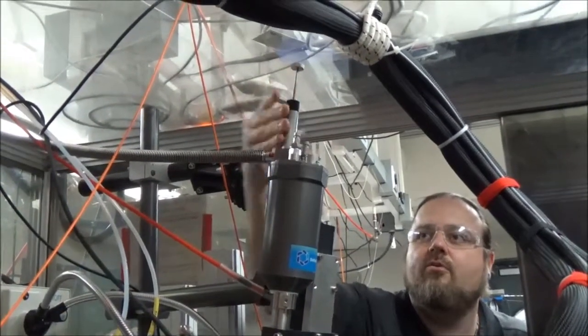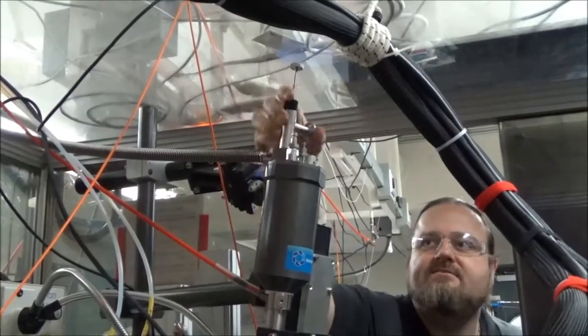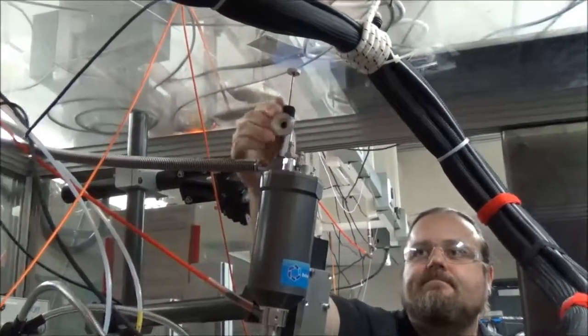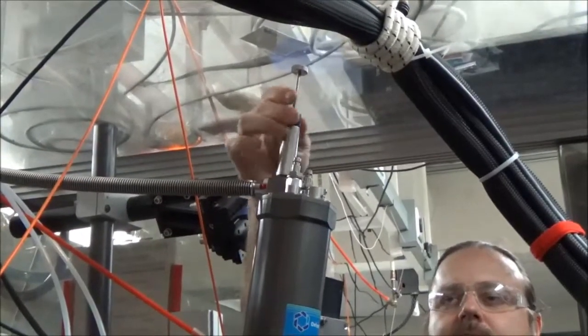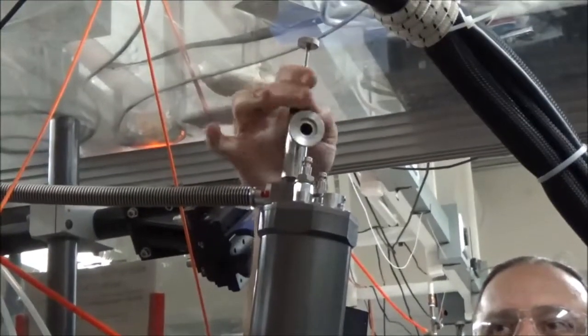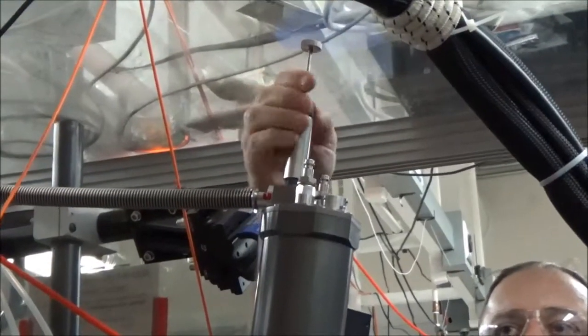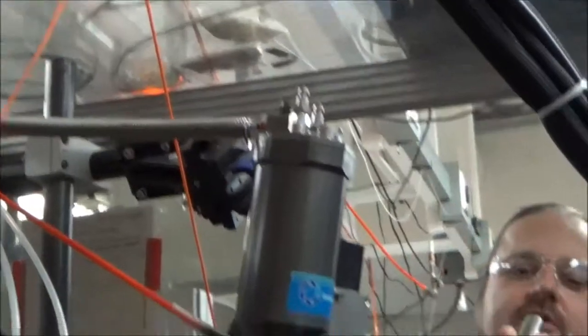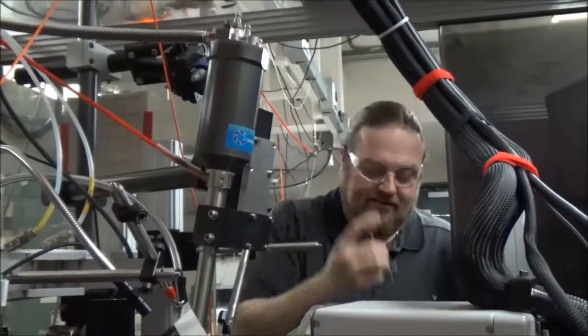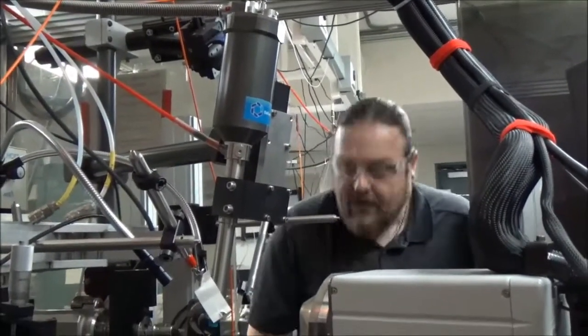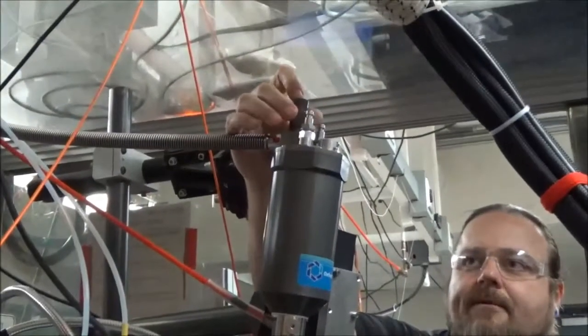All right. So now all we do, we're going to take off this device. All right. It just comes off nice and easy. We'll just have a quick look to make sure the plug's not there. It's not there. It shouldn't be there. We did that just fine. All right. We'll put the cap back on.